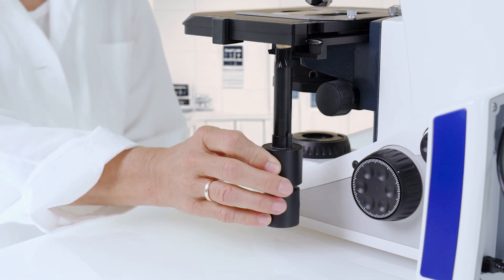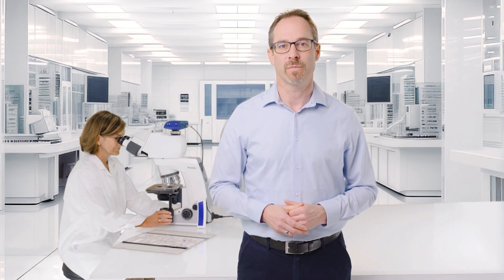Set the stage drive height for a relaxed arm and hand position. This allows you to comfortably move your samples even over extended periods of time.